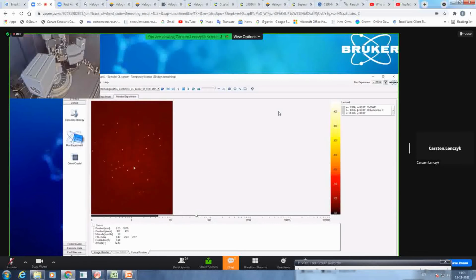The second thing I would check is the shape of the spots. We want to have them as isotropic as possible, meaning we want round circle-shaped spots. We don't want to have them elongated. This is a little normal because it goes more to the outer high resolution part of the detector, but you want to have them as round as possible.